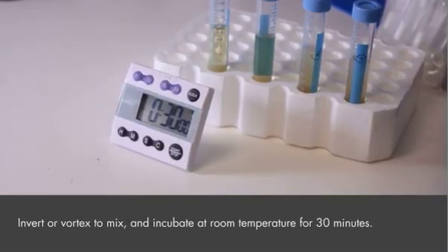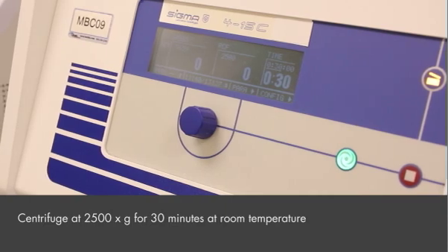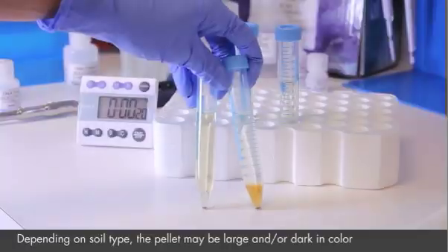Incubate at room temperature for 30 minutes. Centrifuge at 2,500 times G for 30 minutes at room temperature.